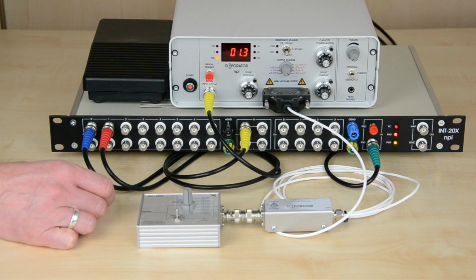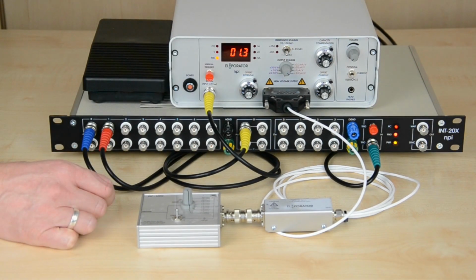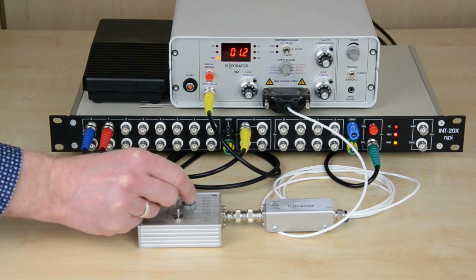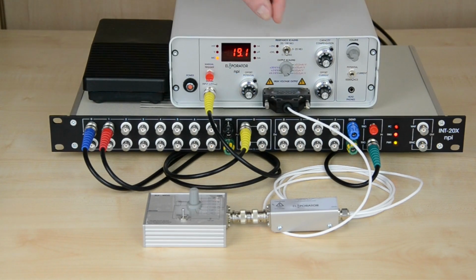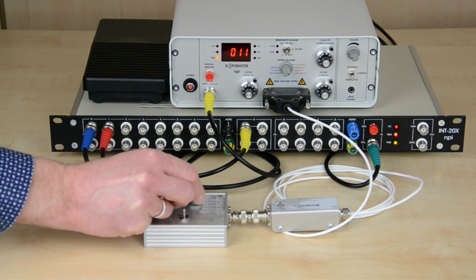In addition to the display, the built-in audio monitor transduces the measured resistance into a pitch. In this way, changes in resistance, as they occur when approaching a cell with the electrode, are made audible. The electroporator has 3 selectable resistance ranges. They can be chosen according to the expected resistances.